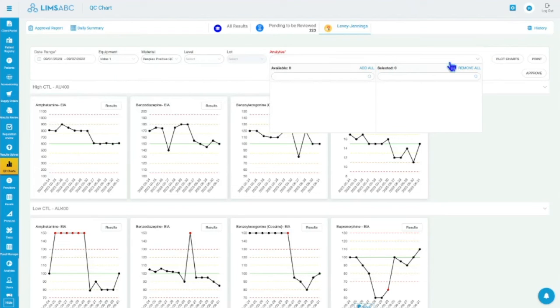We don't have data yet, but chemistry is way closer to toxicology than anything else. The UTIs are a little bit different because you do have negative, positive. It's a little bit different, but chemistry is very similar to this. Besides the target name, which would be a chemistry.